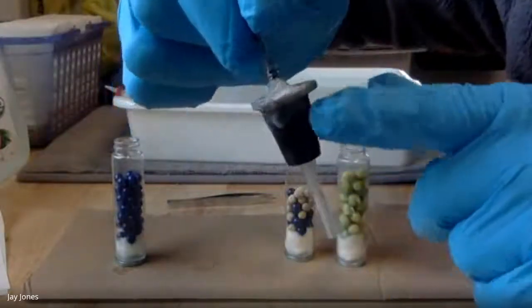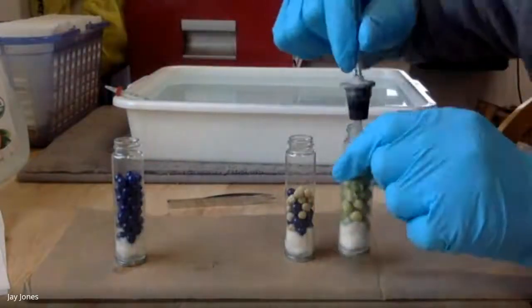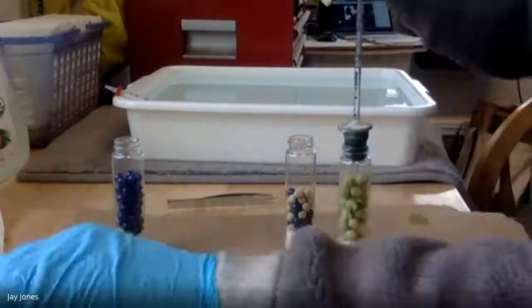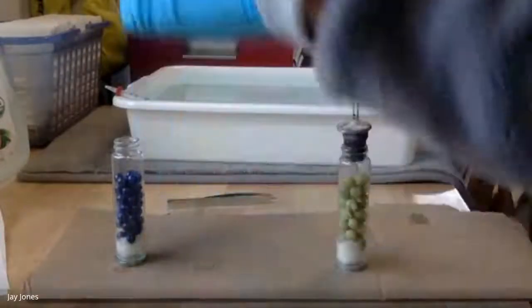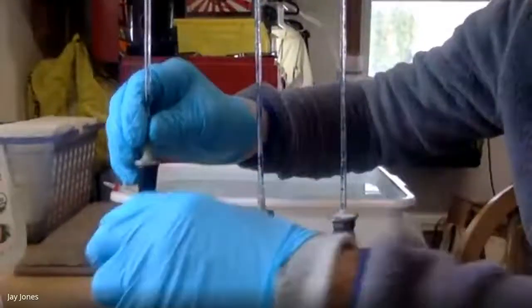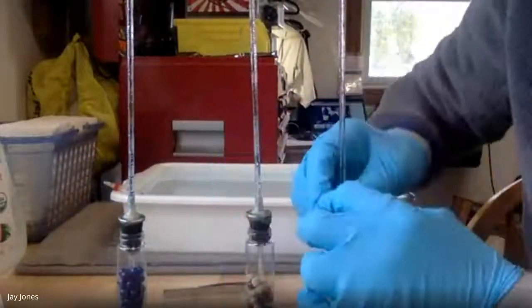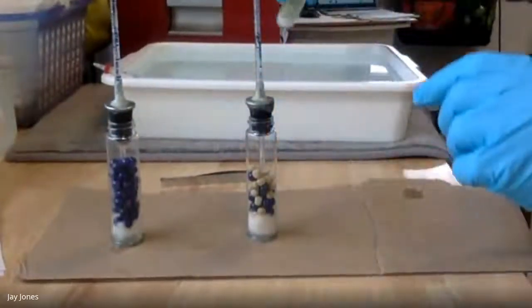And these are sticky, all goopy, but that's goopy for a reason. I gooped them up so that they hold air and don't let water in. Now I blew these out to make sure there's no water in here. Maybe look at these going, what are you going to do with those? Well, let me show you. I push these in nice and firmly.